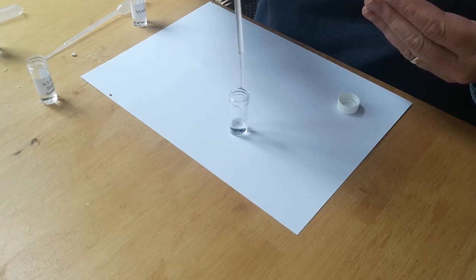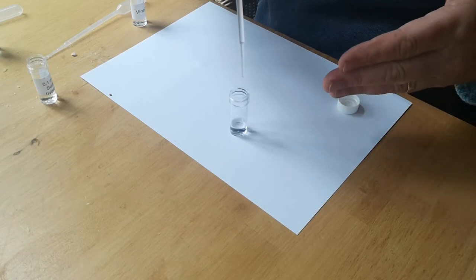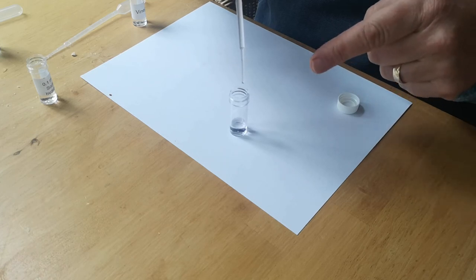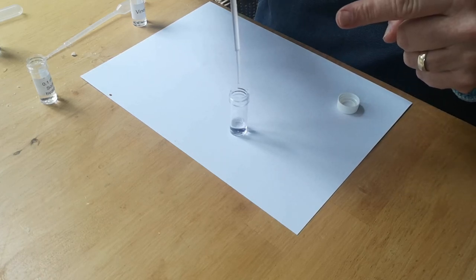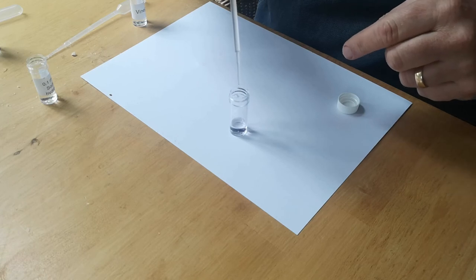Thirteen, fourteen, fifteen. Now you may not be able to see this on the video, but when I add the drop I saw a slight trace of pink which then disappears. That's fifteen, that's sixteen, seventeen.